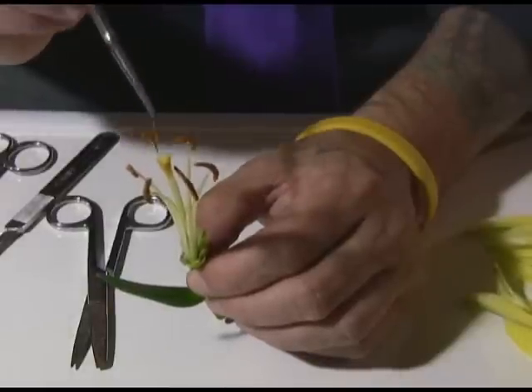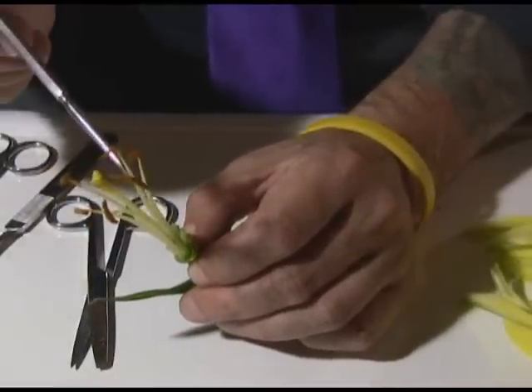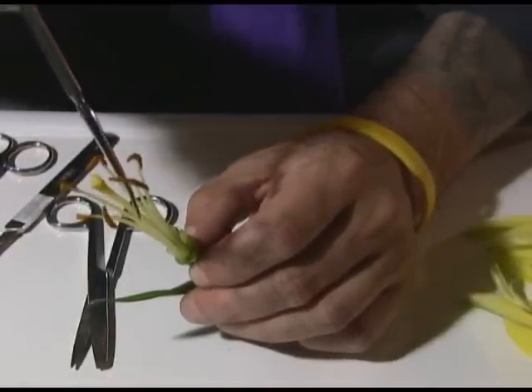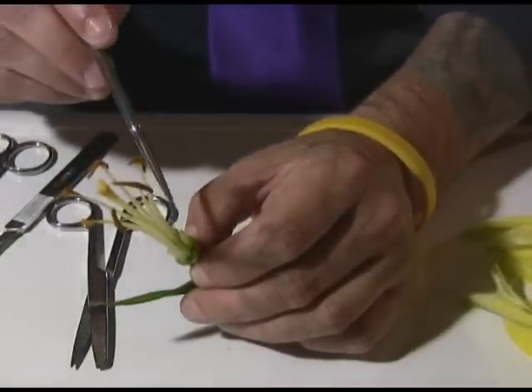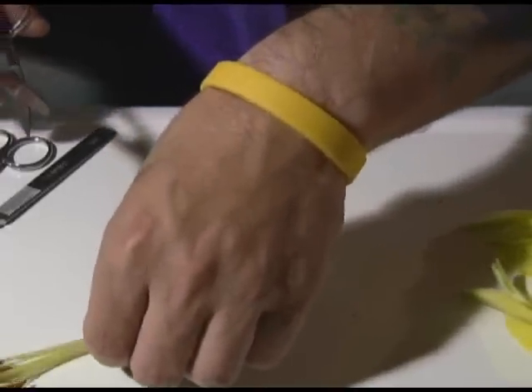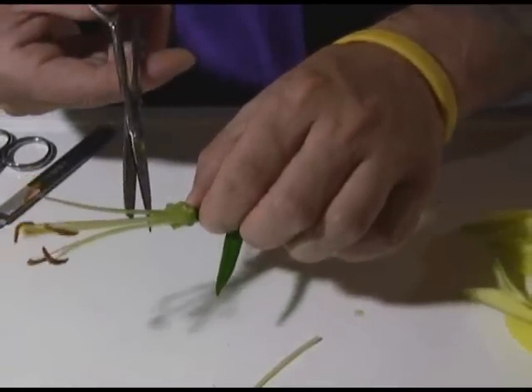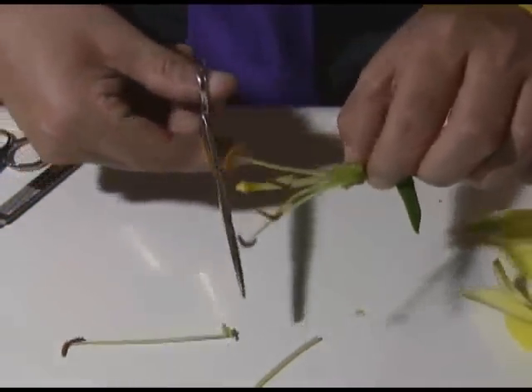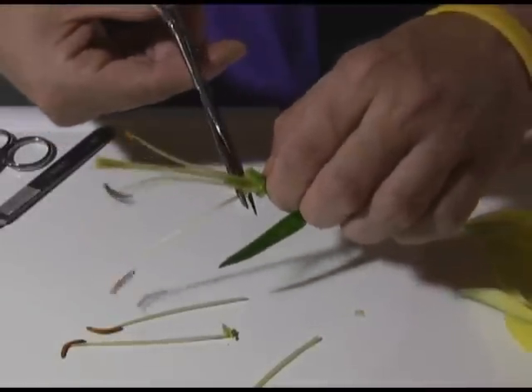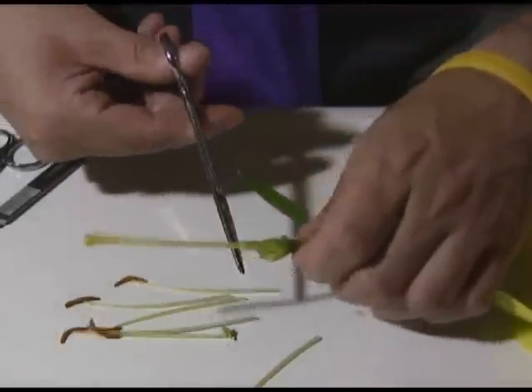We've got the anther that produces pollen, the filament that holds up the anther. We also have the central region here, which is the female part — collectively called the pistil — made of three parts: the stigma that receives pollen, the style that the pollen tunnels down, and deep down inside we've got an ovary. So I'm going to use dissection scissors and remove these stamens — there's one, the second one, and I'll do them one at a time. Already a little bit of pollen is collecting on my work surface.